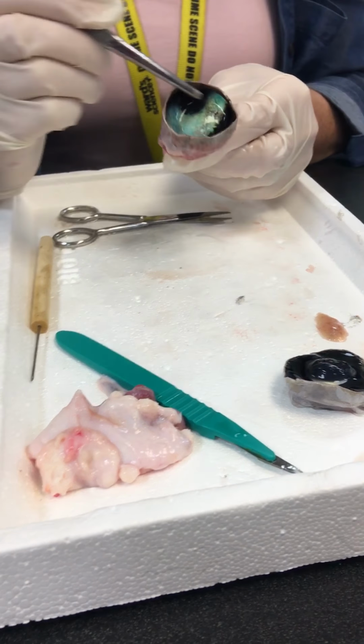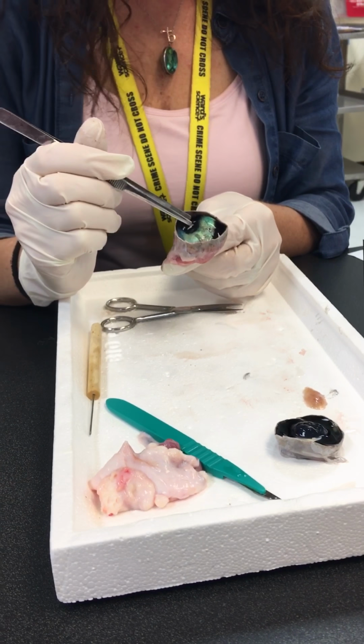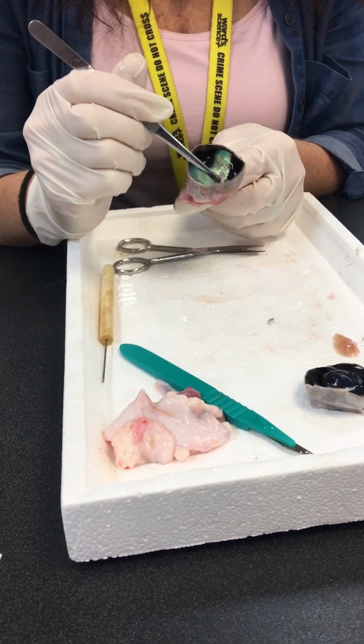This is where it really attaches back here to the optic nerve. Now, if that detaches completely, you don't have a way for your nerve signals to be transmitted to the brain. That is the passageway right there. So if it detaches, you go blind? You can go blind. Now, you can have partial detachment and lose some field of vision. But if you get full detachment, yes.